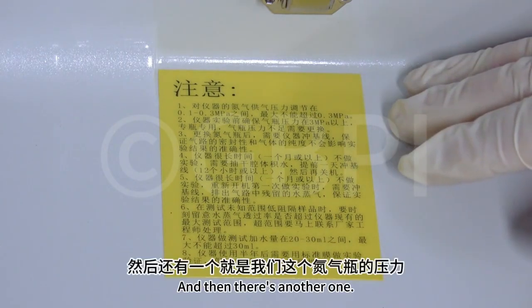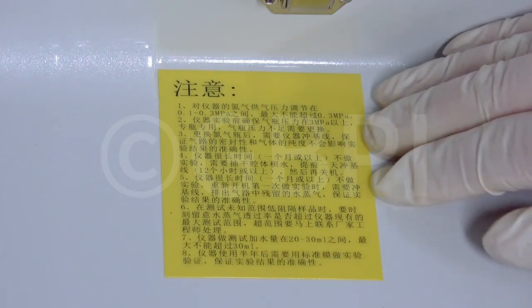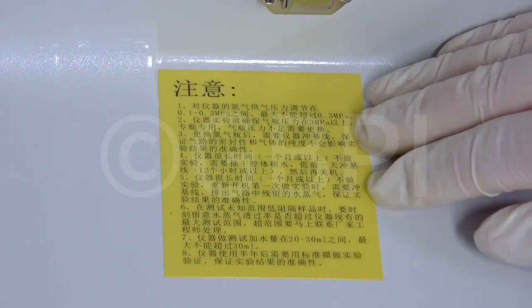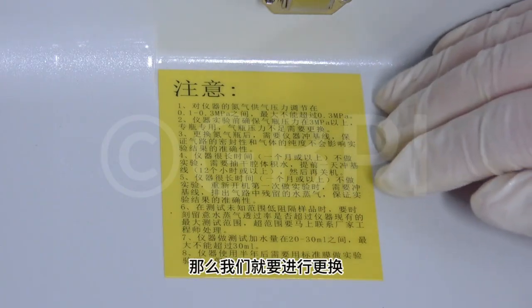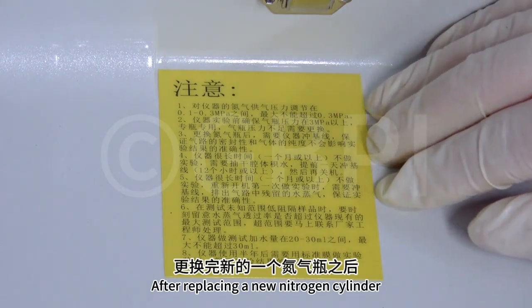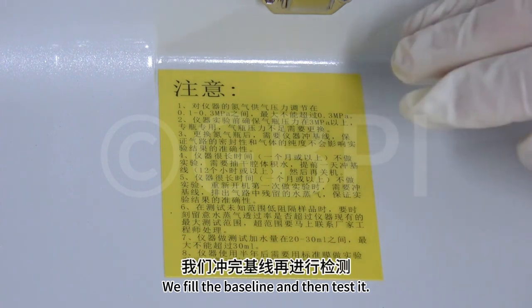And then there's another one. It's the pressure of our nitrogen cylinder. If it is less than 3 megapascals, then we have to replace it. After replacing with a new nitrogen cylinder, we fill the baseline and then test it.